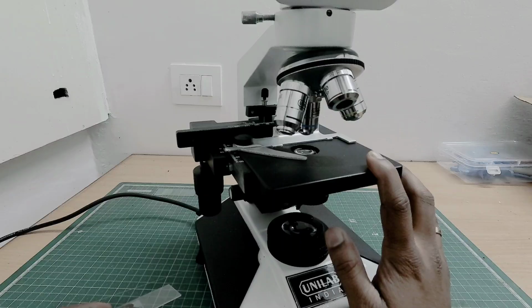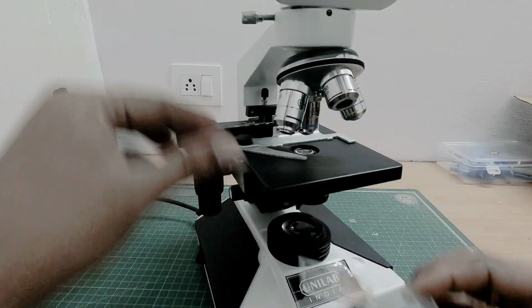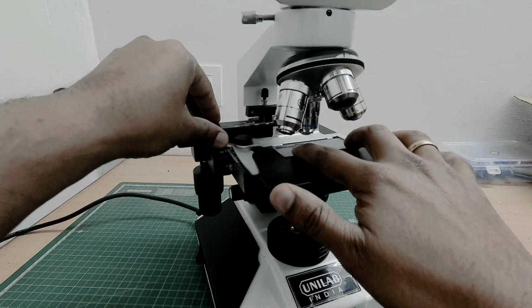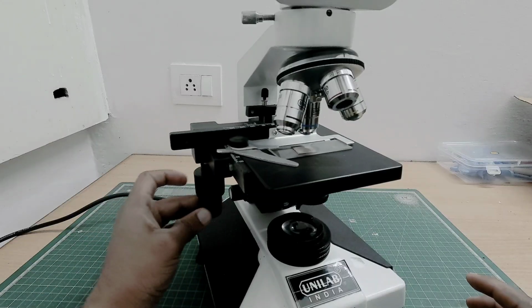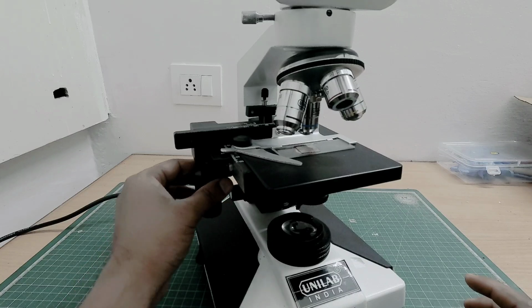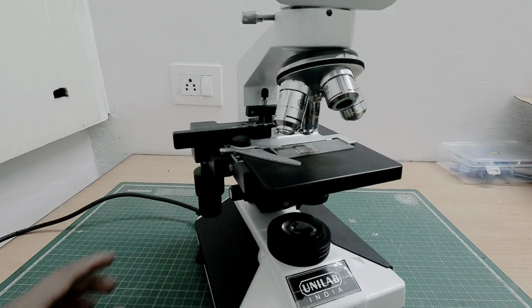Now this is the stage. This is where the specimen is placed. It also has a mechanical clamp where you can place the glass slide. This has two knobs here. One is for the x-axis movement and this is for the y-axis movement. So it helps us to accurately place the specimen at the exact position where it is needed.